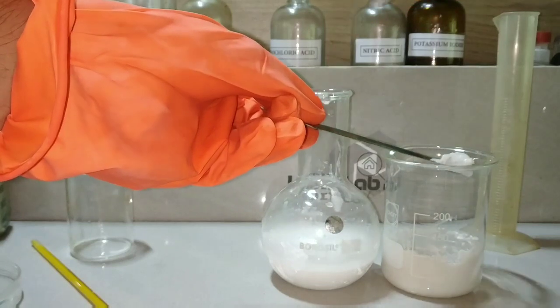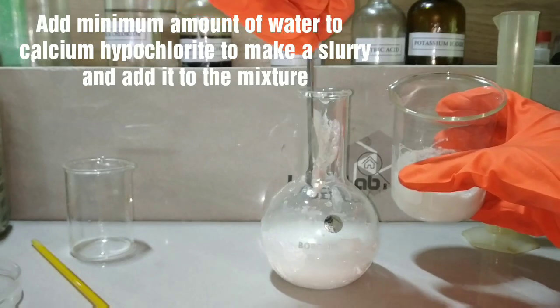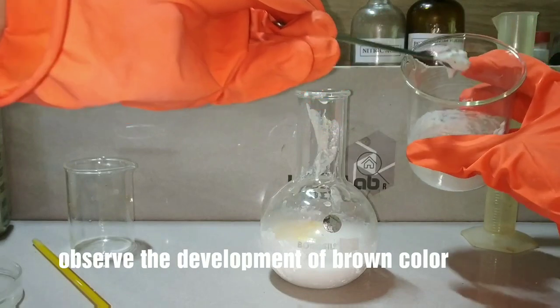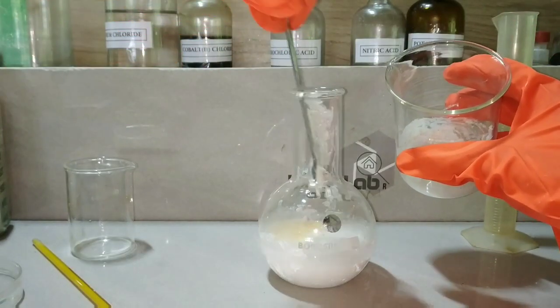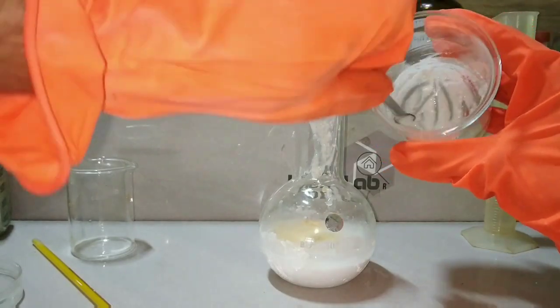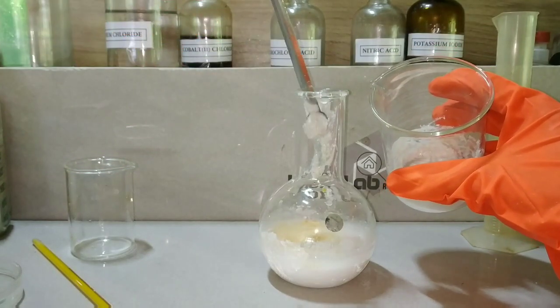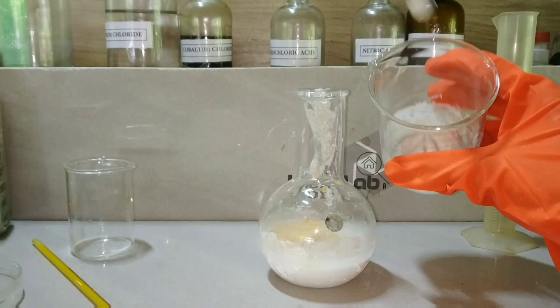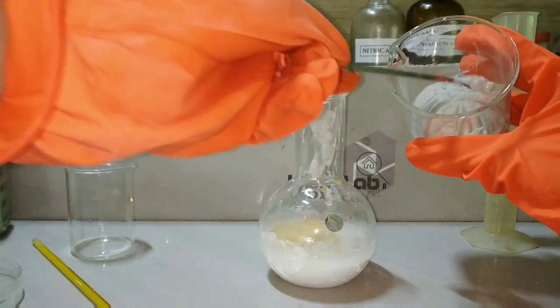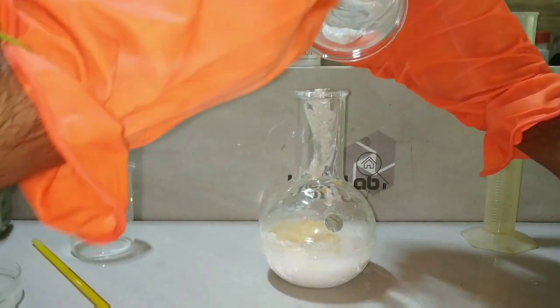Now we will be adding a slurry prepared by mixing solid calcium hypochlorite in a very minimal amount of water. Calcium hypochlorite is commercially known as bleaching powder, which has 33% available chlorine and is commonly used as a disinfectant to purify water. The brown color you see is the lead 4 oxide being formed, because the chlorine present in the calcium hypochlorite acts as an oxidizing agent and oxidizes the lead hydroxide to form the oxide.